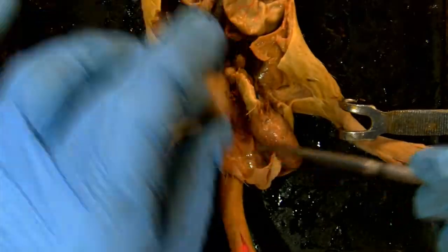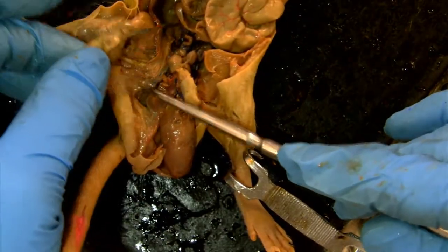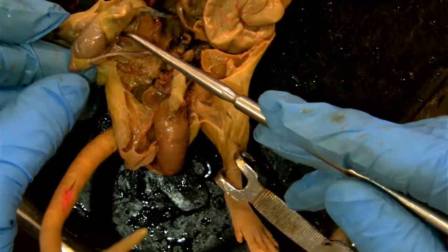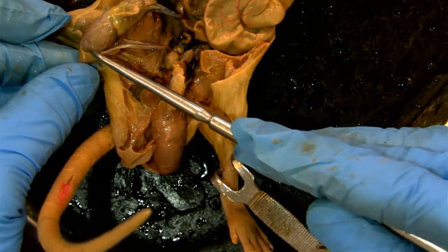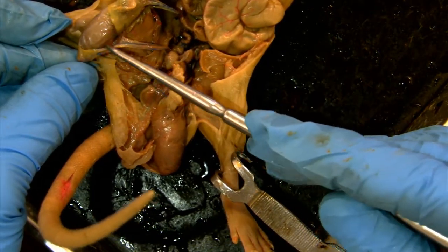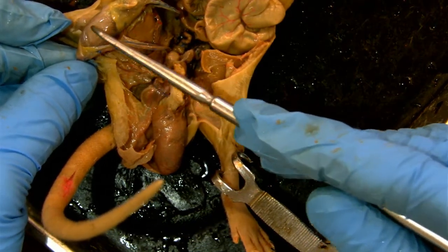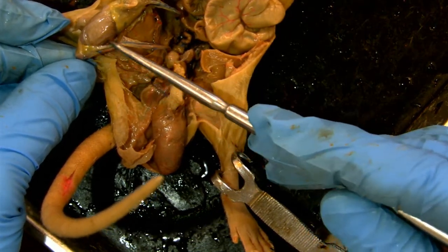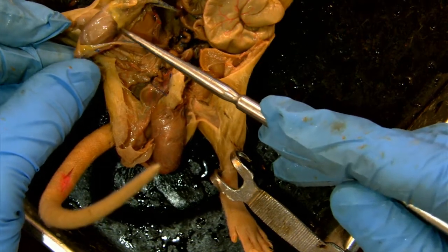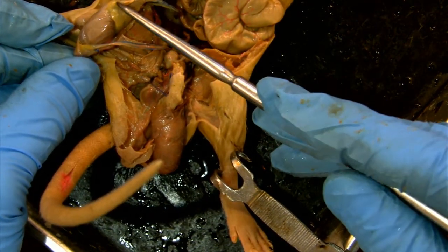Here we have a testis, and the testis has a few parts — primarily this globular region, which is the testis itself, and the surrounding tissue, which has a slightly different color and texture, is the epididymis.